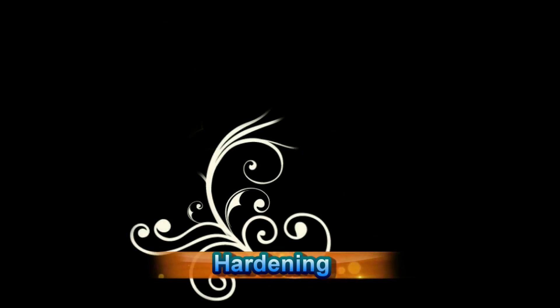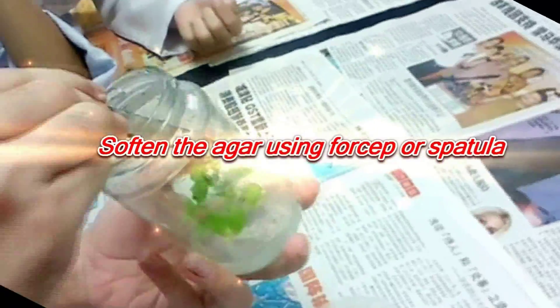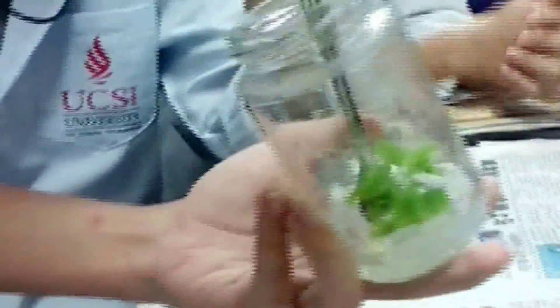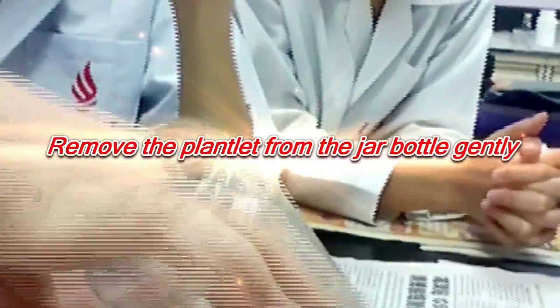Hardening. The hardening process includes the following steps. First, remove the plantlet or shoot culture from the flask carefully, taking note not to hurt the roots. Also remember to add some water into the bottle to soften the agar. Secondly, the plantlet obtained is then cleaned and washed under flowing water for a few minutes to remove the media still attached to the plantlet.